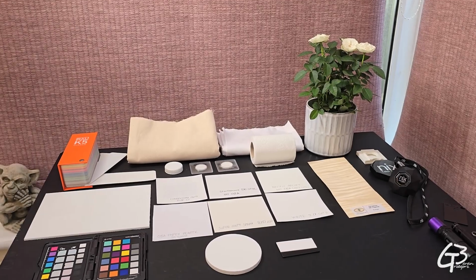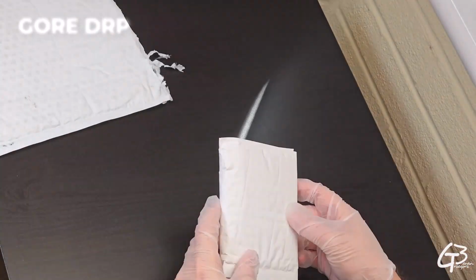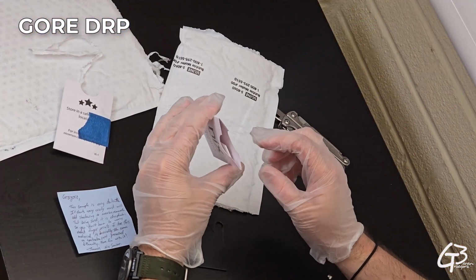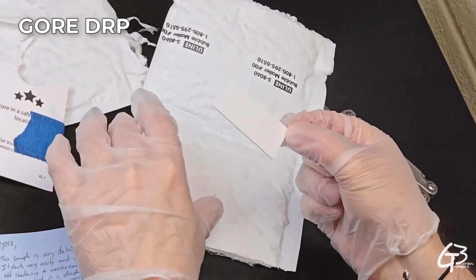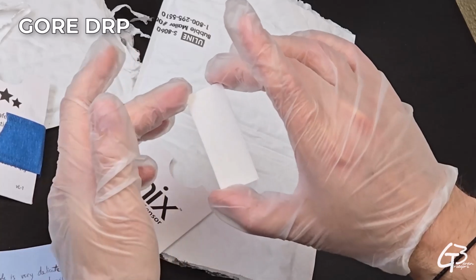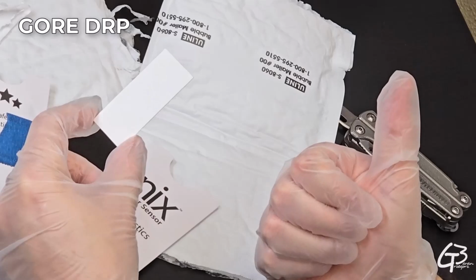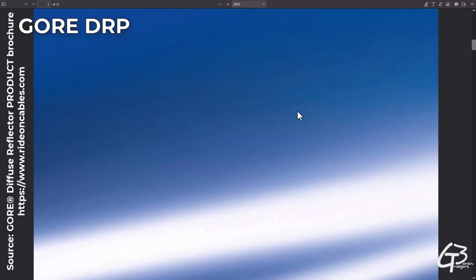These are the substances I collected and which we are going to use for this comparison. Gore DRP diffuse reflector. It's the world's most diffuse light reflecting flexible material. According to the technical specification, Gore has a very flat and stable reflectance curve, also outside of the visible color range. Gore material is engineered with a proprietary membrane of expanded polytetrafluoroethylene, in short ePTFE, a stable microporous structure that consists of multiple polymeric nodes interconnected by fibrils.